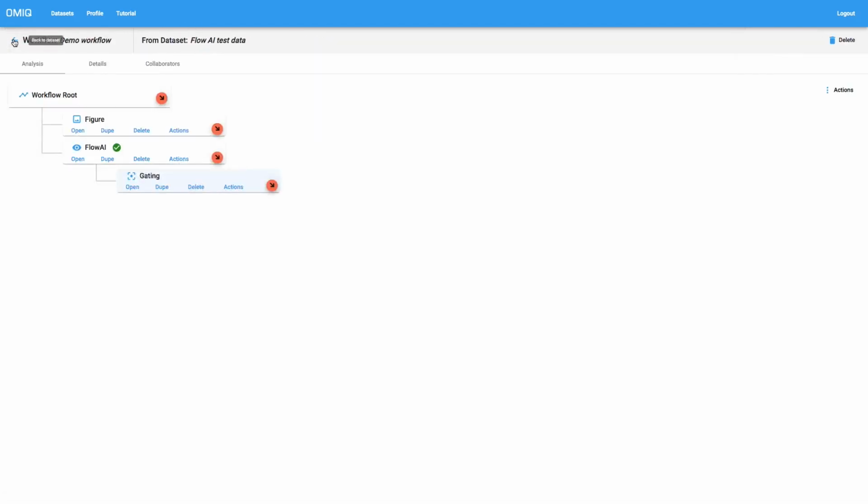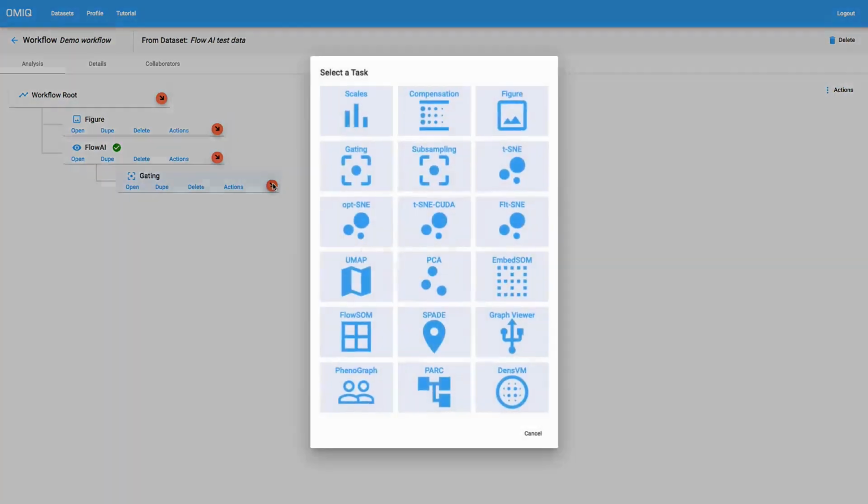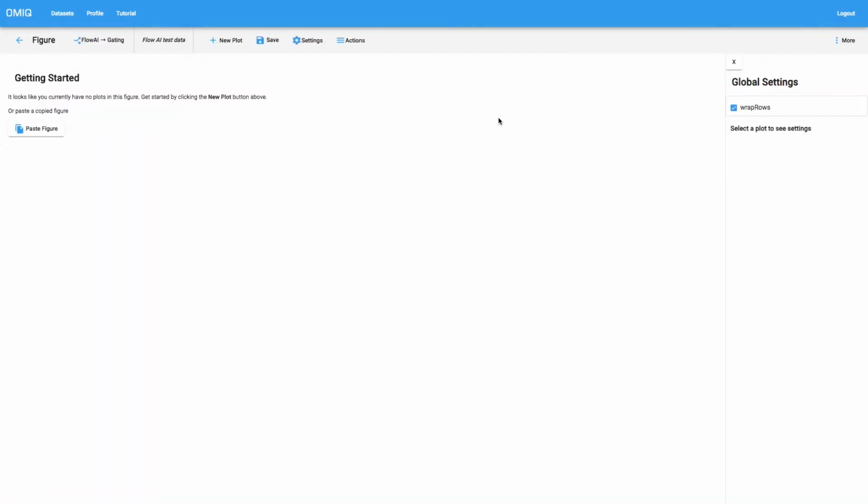And we'll navigate back to our workflow now. And what we have is our original figure and our flowai task, and now it's followed by gating, where we actually categorized just the flowai-passed and flowai rejected data points. From here, it's up to us what we want to do, but probably the first thing we want to do, just for demonstration purposes, is let's make a figure and investigate what the effect of the flowai was. One way to do this is just by using simple plots, and we could use overlays, or we can just keep it simple and use individual scatter plots.